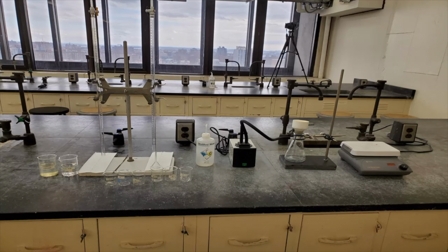This video is divided into two parts. In the first part, we will go over the experimental setup, and for the second part, we will go over the data analysis.